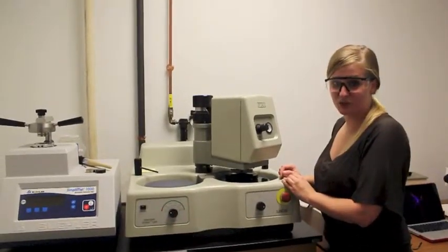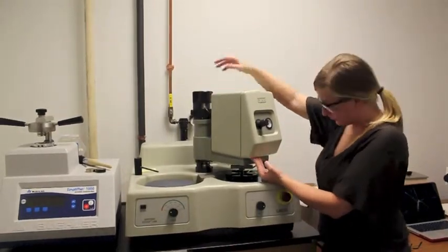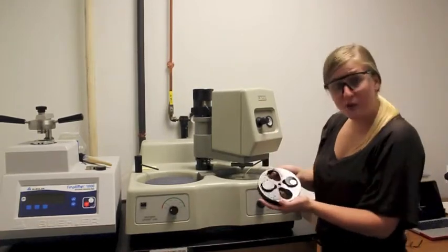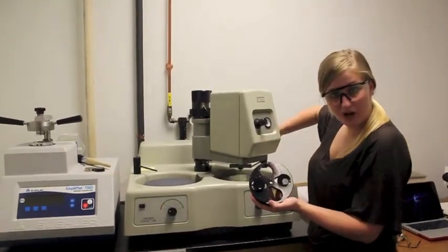To remove your sample, you will want to rotate the post counterclockwise to raise the head. Remove your sample. And if no additional polishing is needed, you may turn your water off.